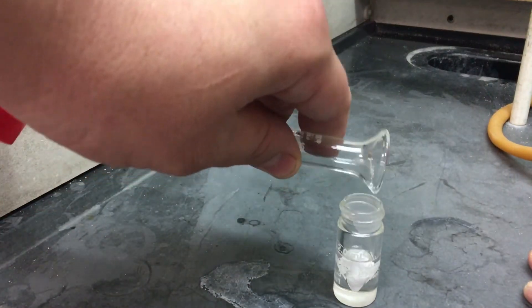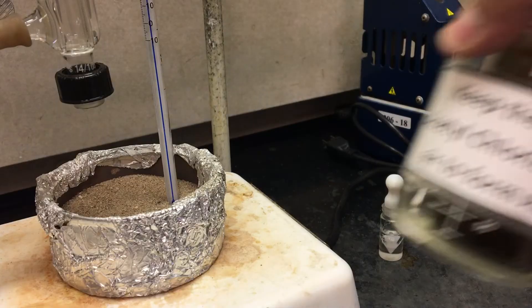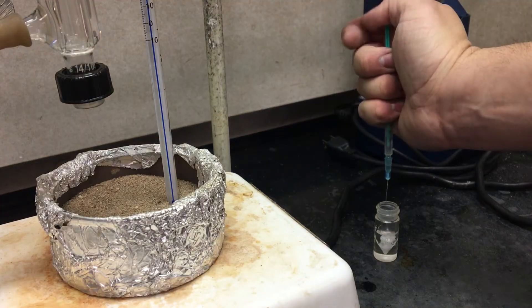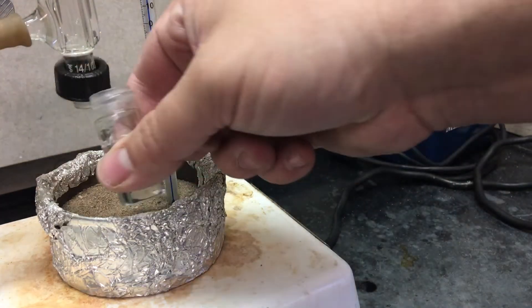Next up is the ethanol, but then you want to cap it so moisture doesn't get in while you're going to wait for the instructor to come and add the acetyl chloride. The moment it stops bubbling, you want to connect it to your apparatus and get the reaction started.